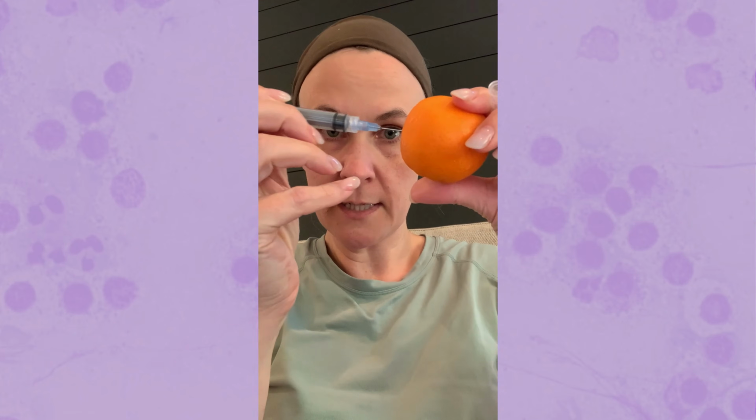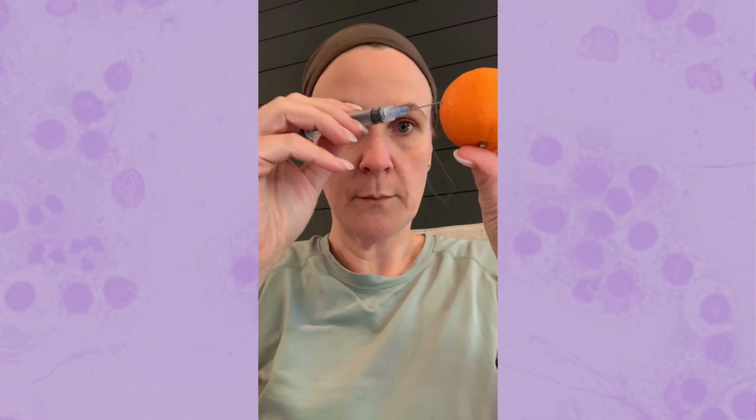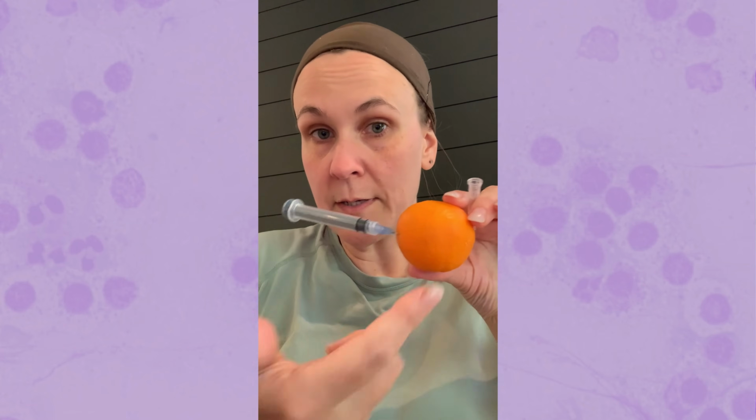Well, if your mass is big enough, I have a demo. One thing you can try is, instead of sticking your needle directly into the center of the mass, which is what we all tend to do, and that's fine, try to direct your needle more towards the periphery. Remember, the center is more likely to be necrotic than the areas around the periphery. The whole thing might be necrotic, but this is at least one way you can try to get a sample that has enough viable cells that we can tell who they are and make a diagnosis.